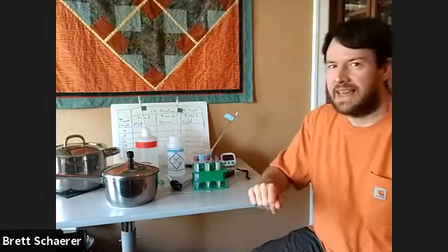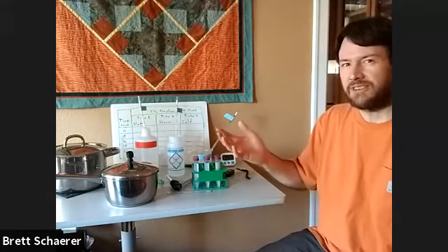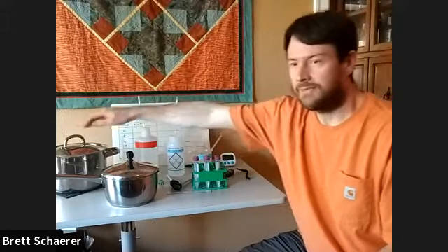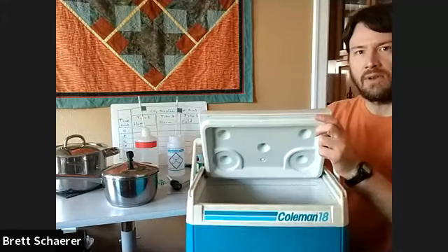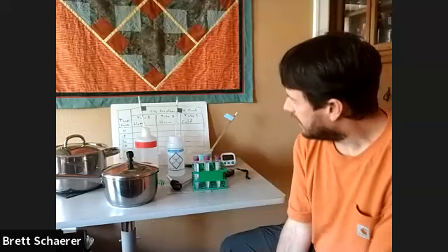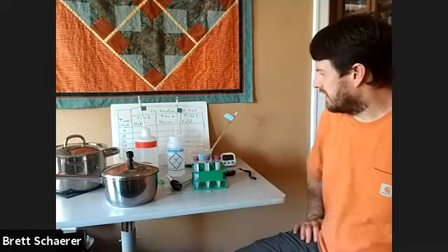The one I'm going to use today is temperature, because this is easy to do with things from my kitchen. So I have 3 different temperature environments. There's a pot of hot water here, a pot of warm water, and then a cooler with some cold water. And I will measure the temperatures in a little while once the experiment gets going.